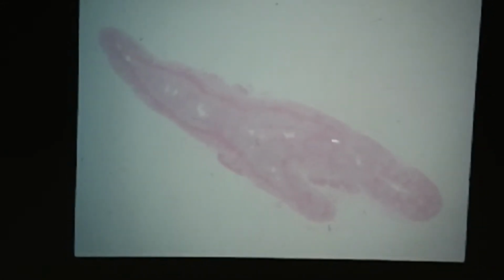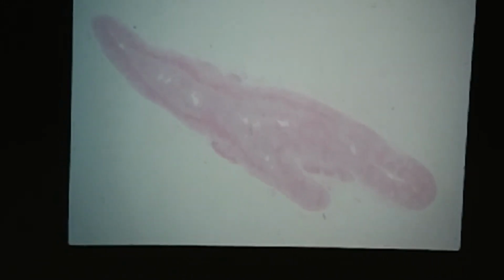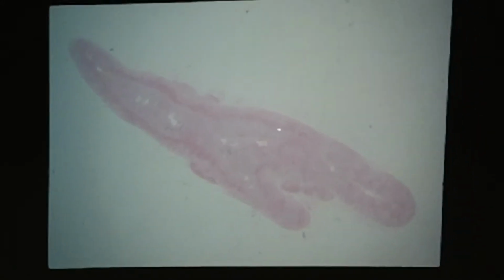Adrenal gland. And this is something we've got to address. The staining is really poor quality on this. But nevertheless, if you have a sharp eye and are willing to look, you can distinguish an outer cortex surrounding an inner medulla, and key features on the medulla are these large medullary veins. You can almost hallucinate that the reticularis tends to be a little darker staining. So that's the region of the fasciculata. And then the glomerulosa, oh, here it is. Glomerulosa should be right subjacent to the capsule.